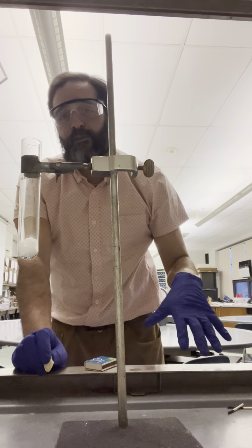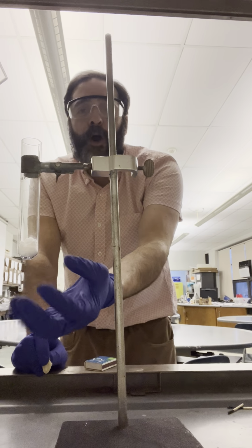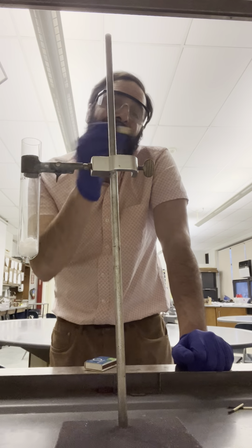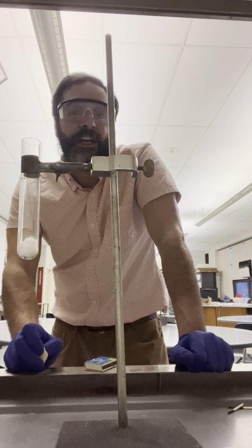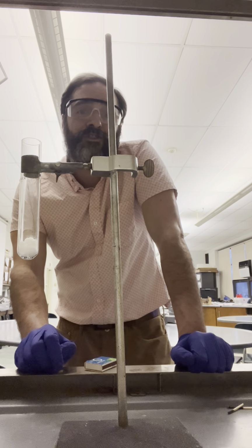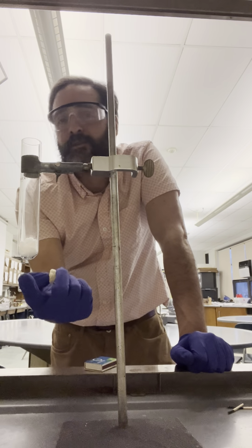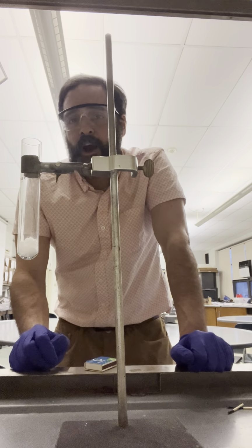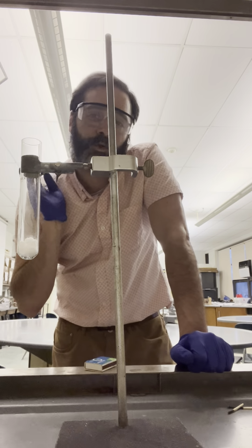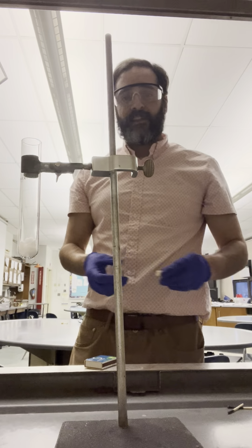I'm going to have to close the fume hood. It's going to make a lot of smoke, and you're going to see a lot of sparks and stuff going off in the test tube as the gummy bear is reacting. So that's the second part. That reaction is extremely exothermic. You will see all the heat being produced, and it also doesn't require a ton of activation energy. I do not need to keep the Bunsen burner on the chemical to keep it going. I'm going to take the Bunsen burner away once it decomposes, and the second reaction will just push ahead full steam. So let's take a look at this demonstration here.